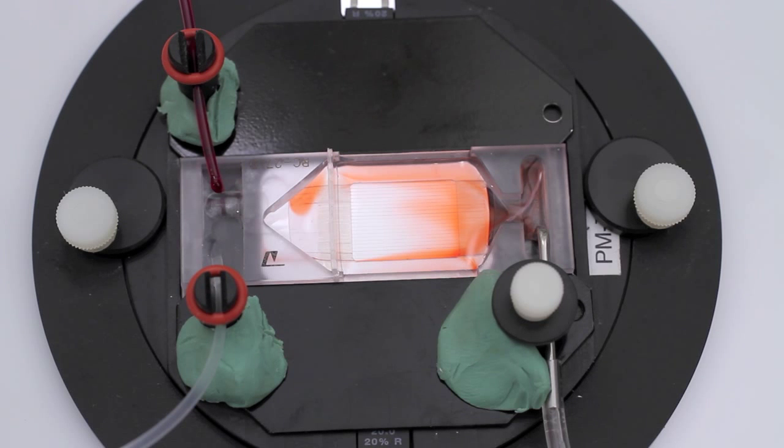A buildup of silicone grease can impede the flow of solution between the two wells and is a common cause of disruption of perfusion through the chamber. Be sure there is no extraneous grease in the chamber or bath during or after assembly.